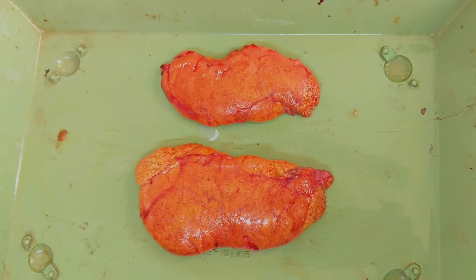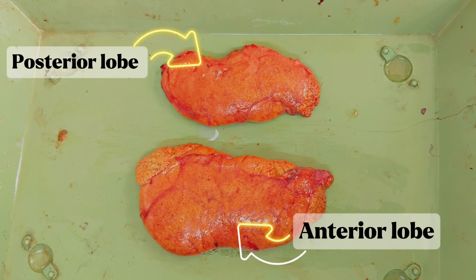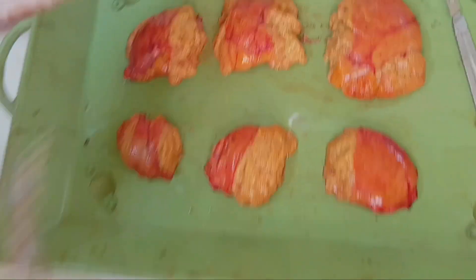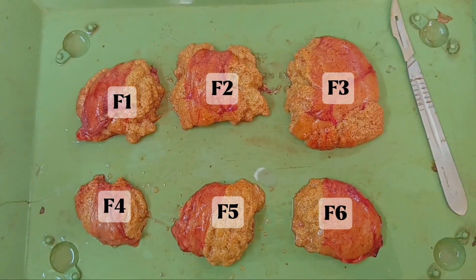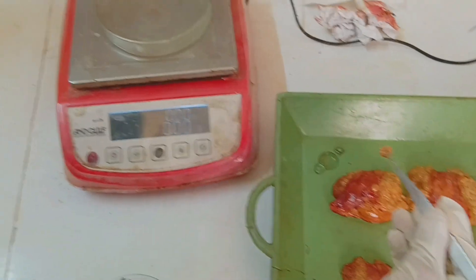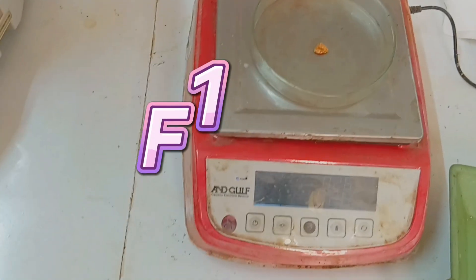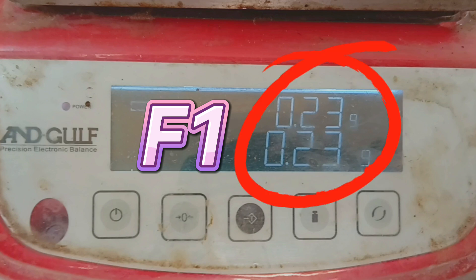For the gravimetric method, we first identified the anterior and posterior lobes of the ovary. Each lobe was then divided into three parts, and we took a subsample from each part labeled as F1 to F6. Next, we weighed each subsample precisely. For example, F1 weighed 0.23 grams, and so on for the others.